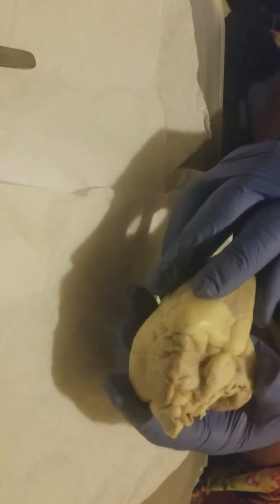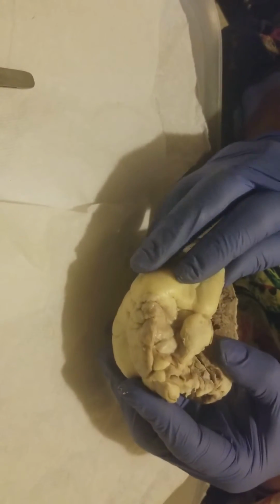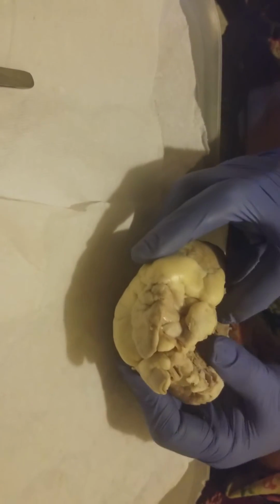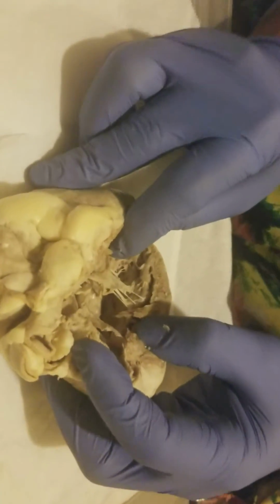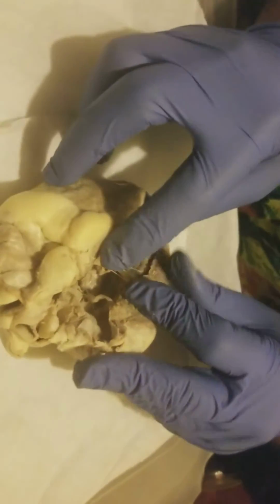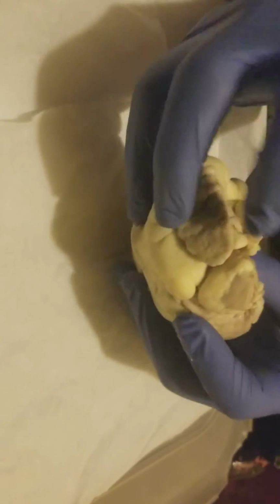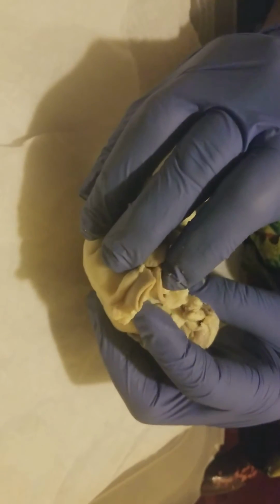Another thing that I noticed in here is that the left ventricular wall is thick, really thick. You can see here it's really thick, thicker than the right one. And then we have the aortic semilunar valve on the left ventricle down there. The pulmonary semilunar valve is inside the right ventricle right here, and then this aorta up here carries blood to almost all the parts of the body, the aorta.